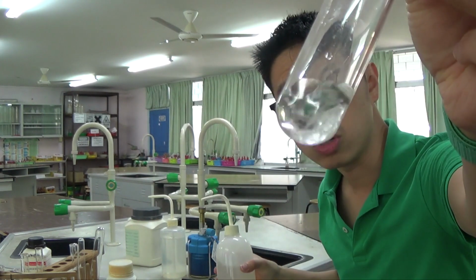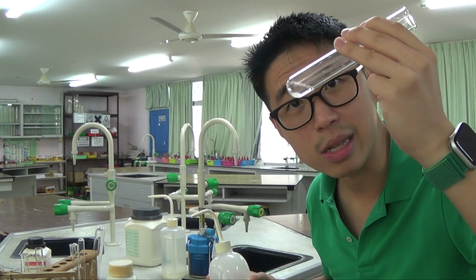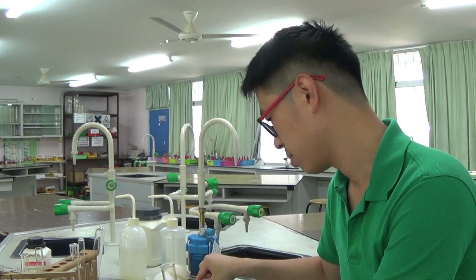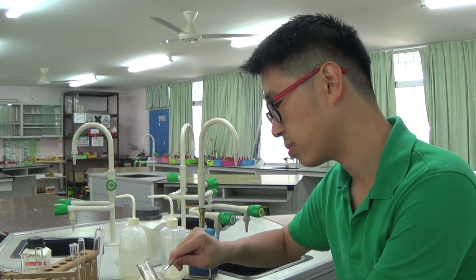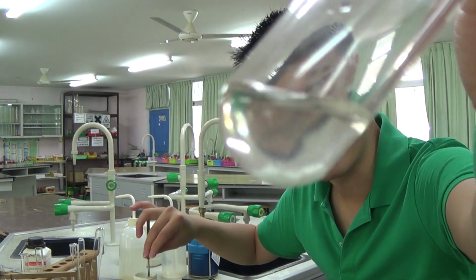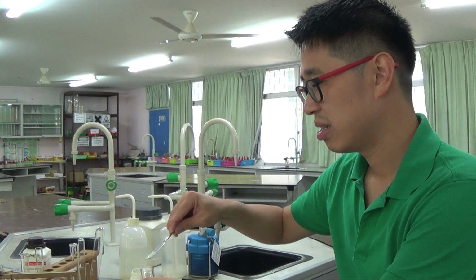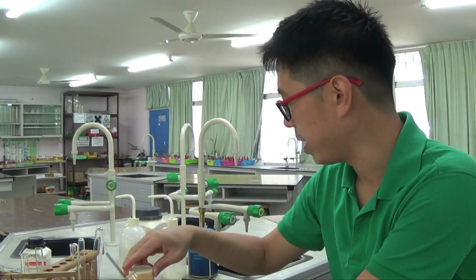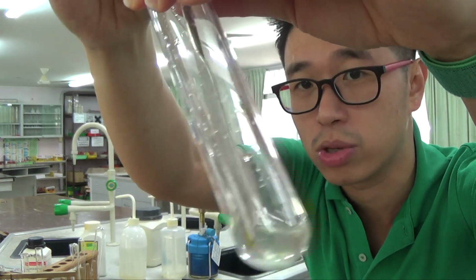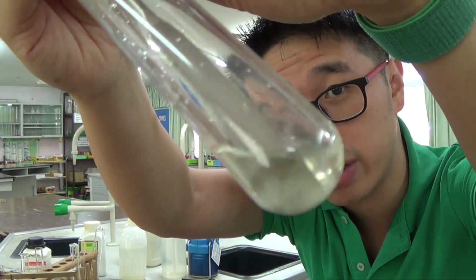Distilled water contains no dissolved ions. This solution doesn't look so clear on the screen, but I can see that it's a little bit pale greenish. I can add a little bit more of the solid if I want to. Maybe I'll add a little bit more of the solid. It's still not very clear on the screen itself, but it's starting to look a bit greenish. So I won't put the spatula back into the container again, because you never put the spatula that has water or solution on it into the container itself. Okay, so I think it's getting clearer on the screen that it's starting to look a bit colored now.